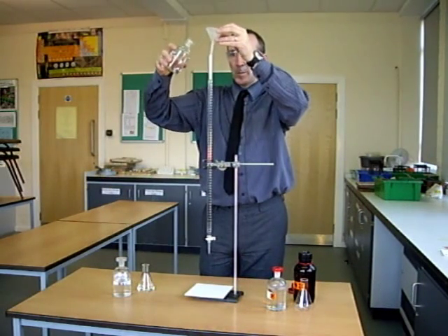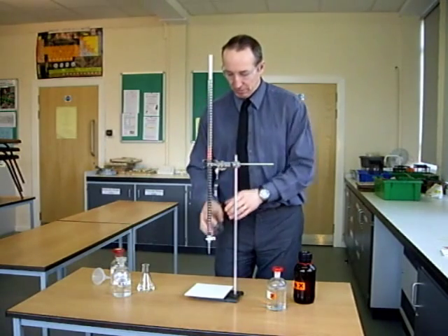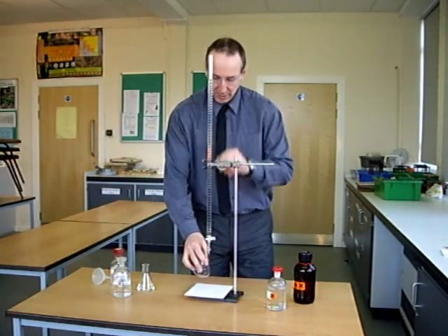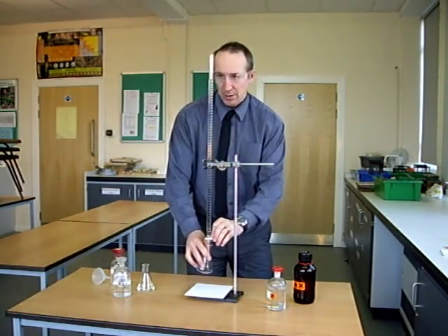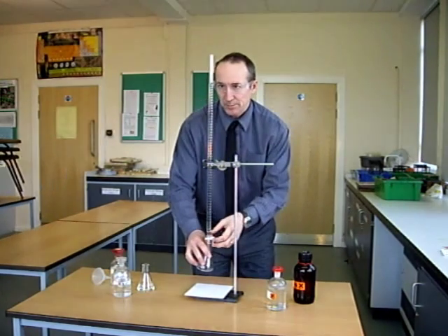Throughout the titration, always think about this conversion factor of 1000 between moles per decimeter cubed and moles in each centimeter cubed. I've slightly overfilled the burette, and what I want to do now is run some of the hydrochloric acid through the burette until we get down to 0.